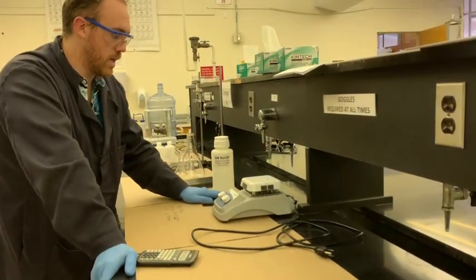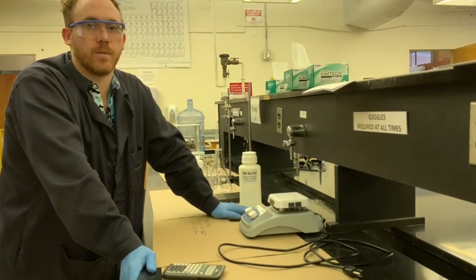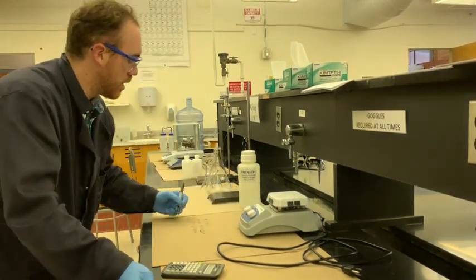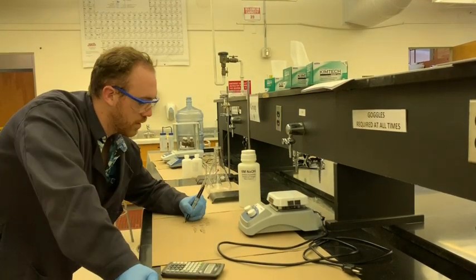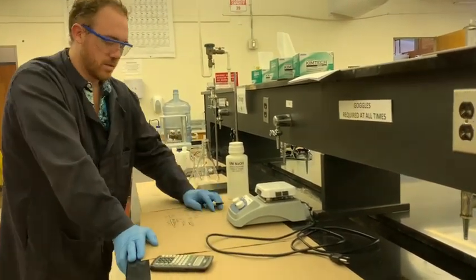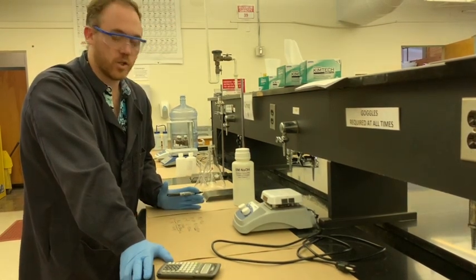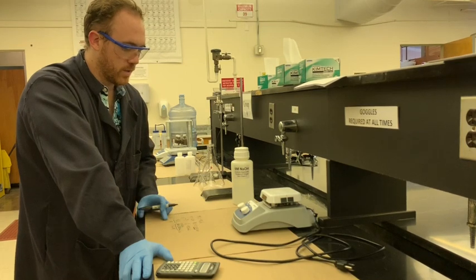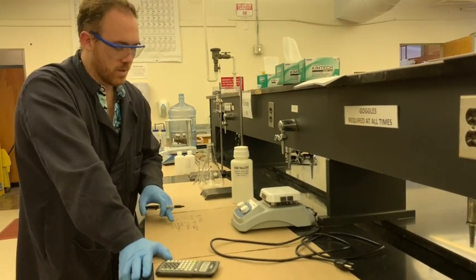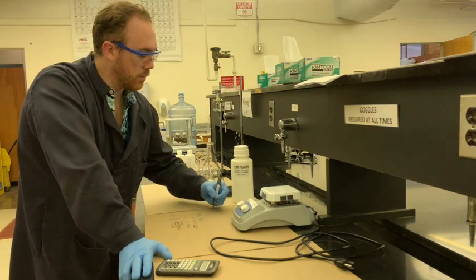Now because you're working with molarity, it can be done in terms of liters or milliliters. The key is that you just make sure that you don't forget which unit you use in your calculation, because they're going to be proportionally concentrated. So all you have to do is set up the calculation. Once you take your calculation, you're going to line up all your numbers and just make sure that you have everything straight. V1 is equal to M2V2 over M1. And that's going to be equal to 0.250 molar times 500 milliliters divided by 6 molar.